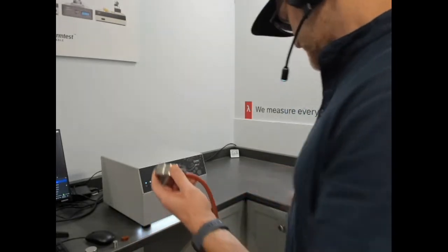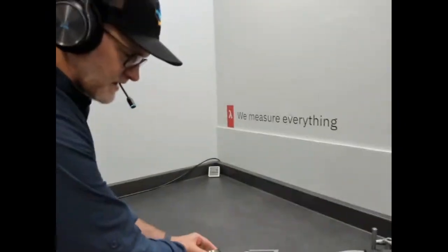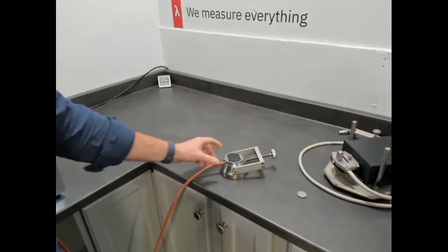So we're going to spin the camera around and come a little closer. This is the benchtop seat for the MTPS sensor, which just makes it nice and convenient.